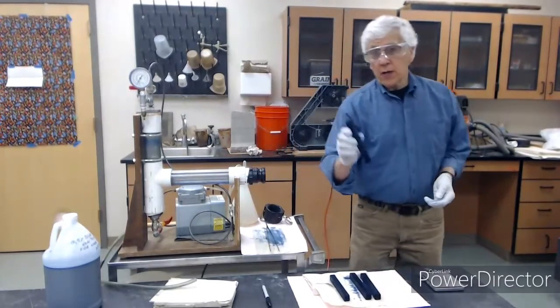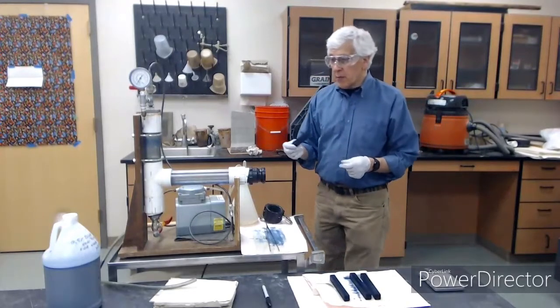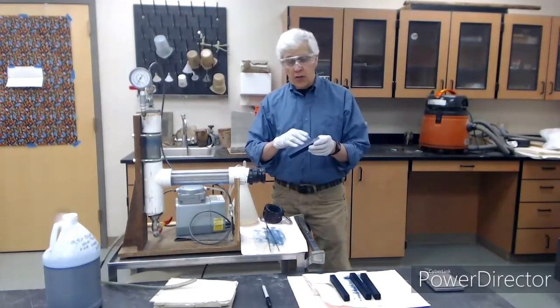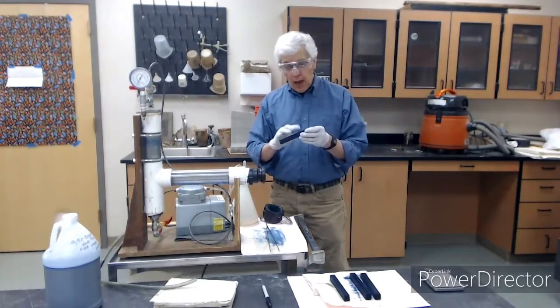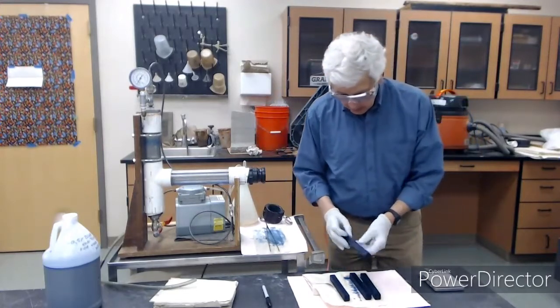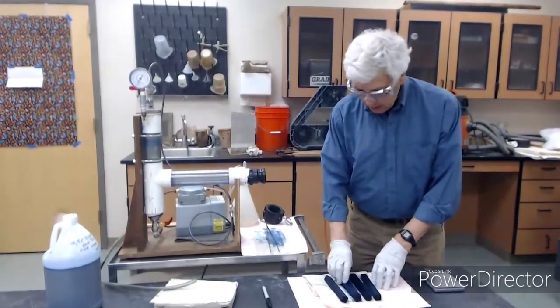So what happens there is we had it under 60 psi, and then we released the pressure, but it takes a while for that pressure to equalize. And as it does, it can push the liquid that's inside out to the surface so it bleeds. So you can see a little more coming up now. So we'll just give it a little chance to do its thing, and then we'll weigh it.